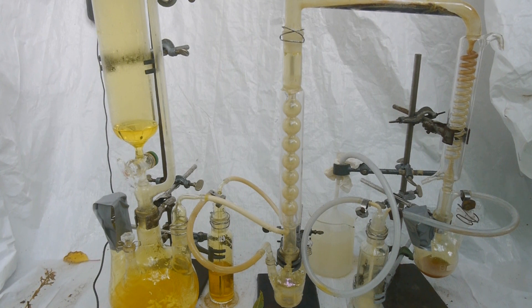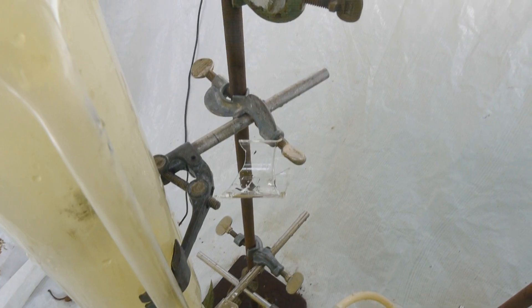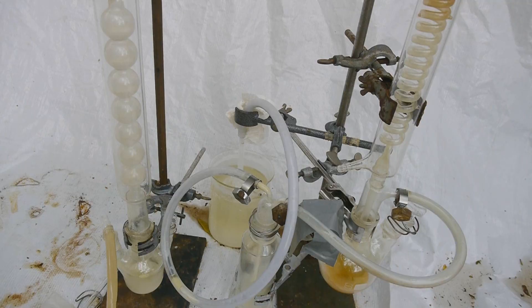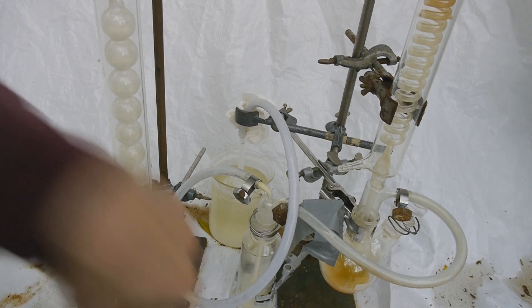The good thing about this reaction is that once it's going, it's going. Usually when the chlorine is running, I don't have to heat it anymore and it keeps dripping. My beaker broke right there and the shard got stuck there — that's kind of funny. Now it's time to secure my product and hope I don't get killed by the TiCl4 vapors.